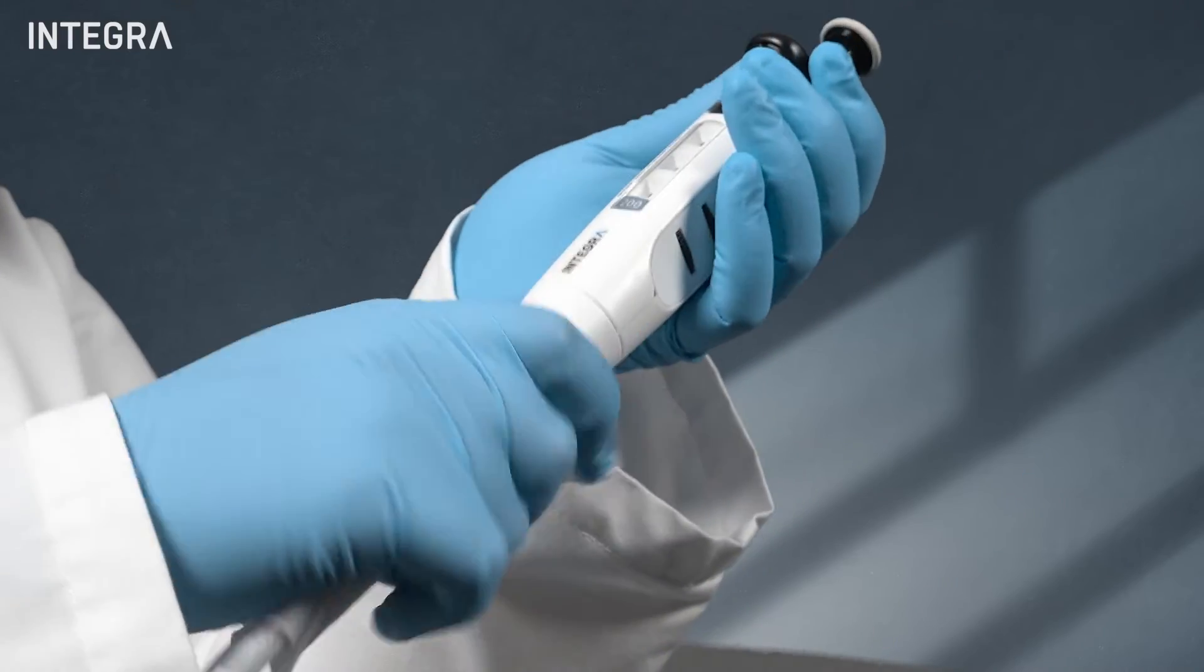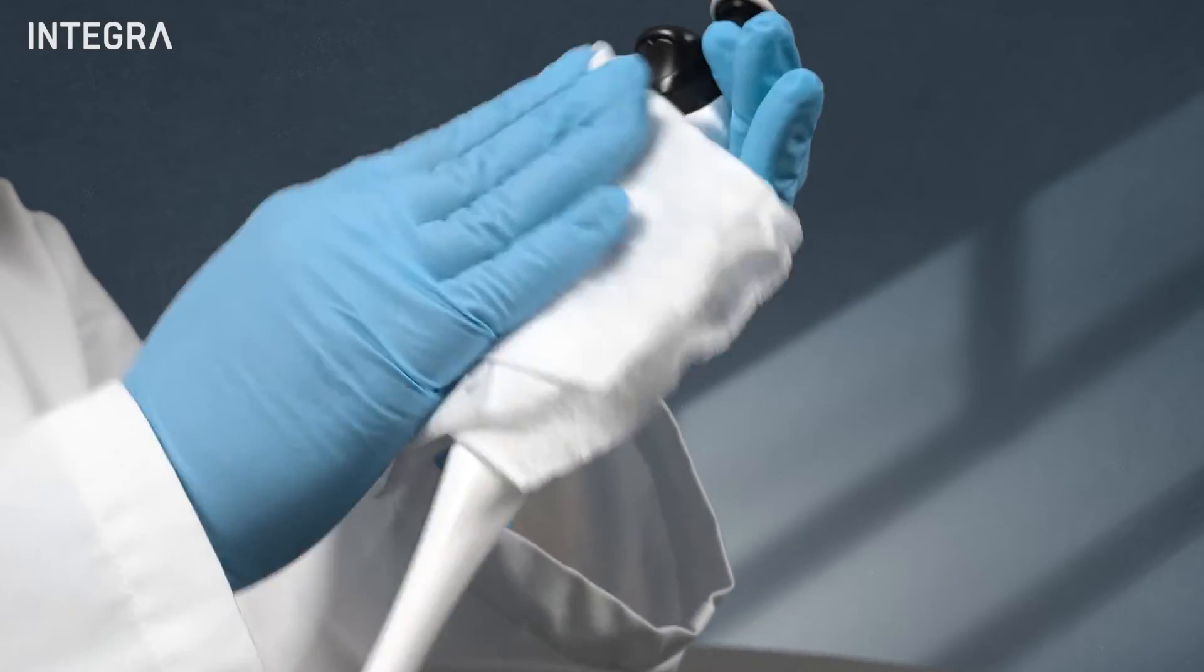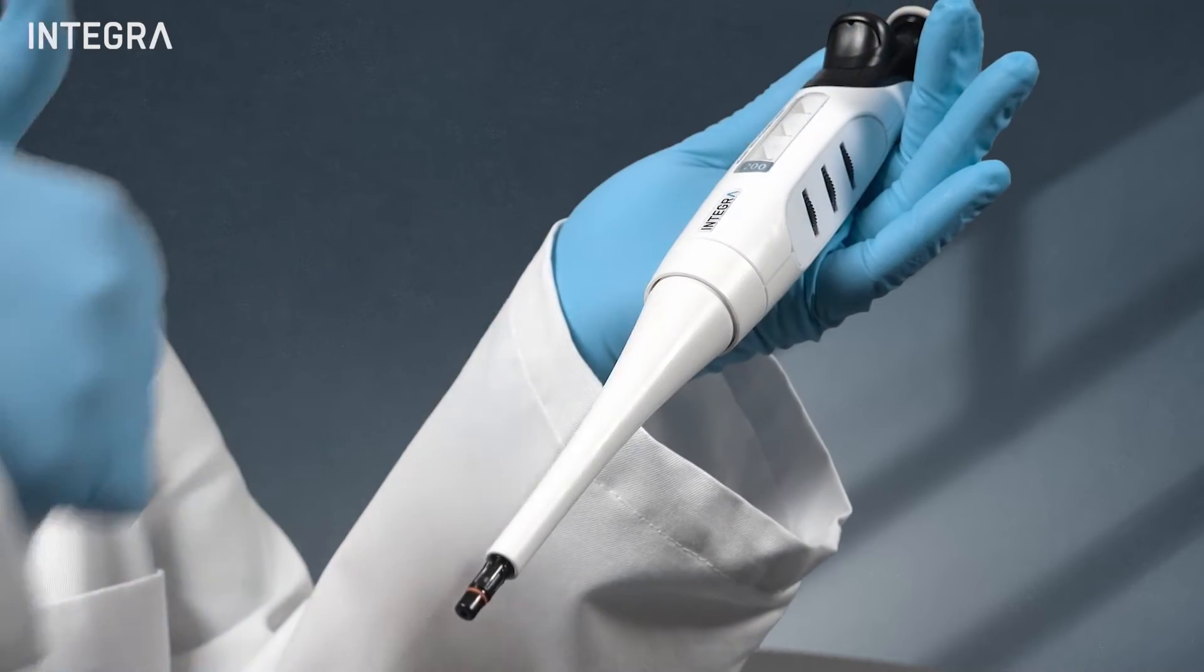Wipe down your pipette with ethanol, isopropyl alcohol, or another decontaminating agent after working with it.